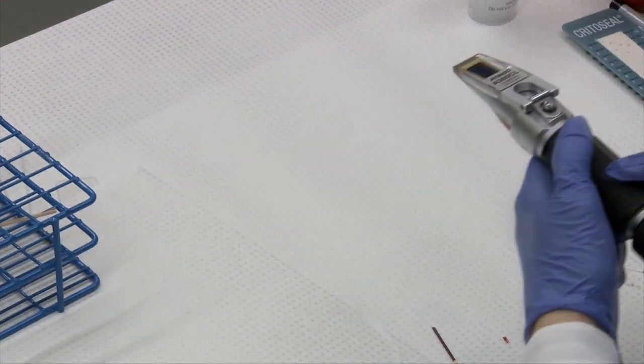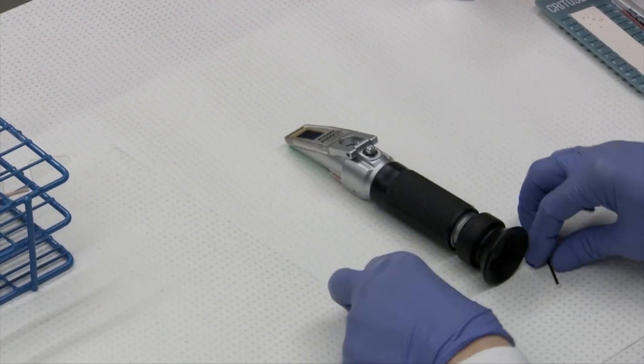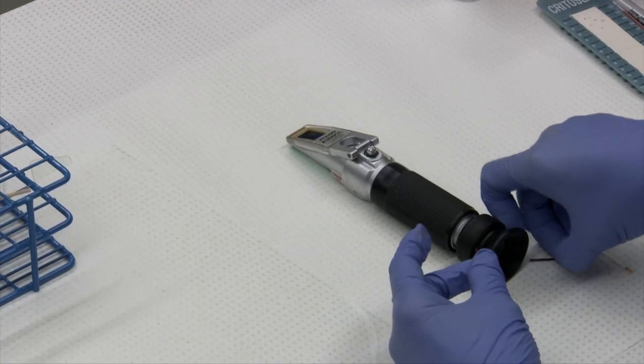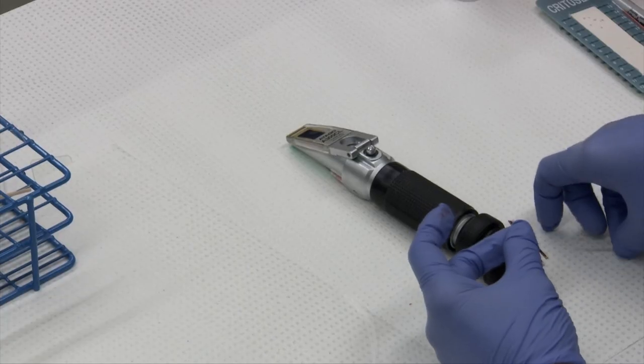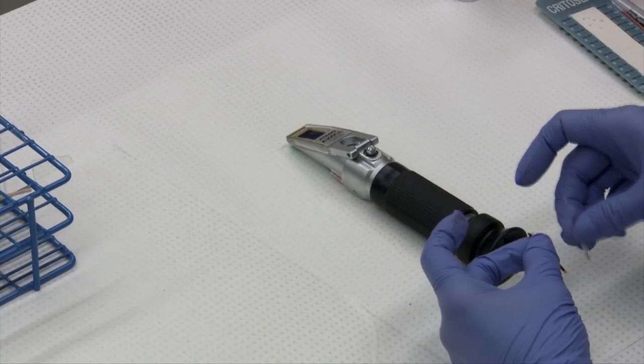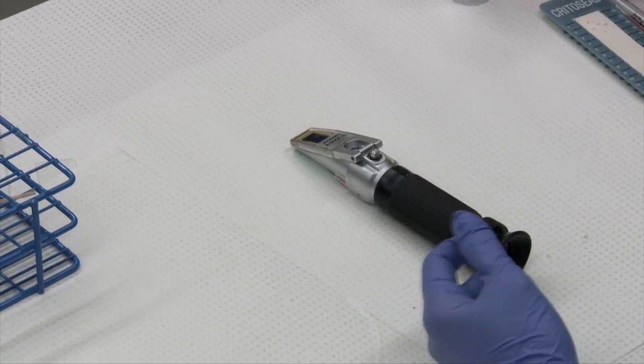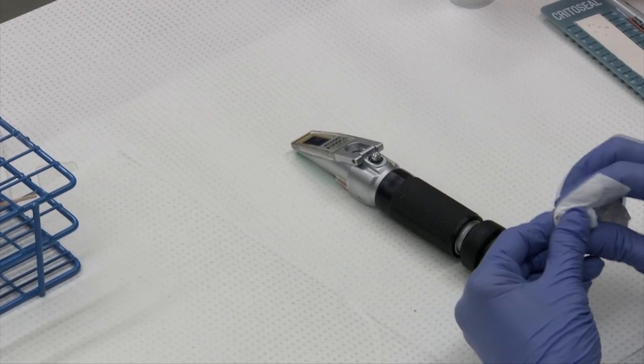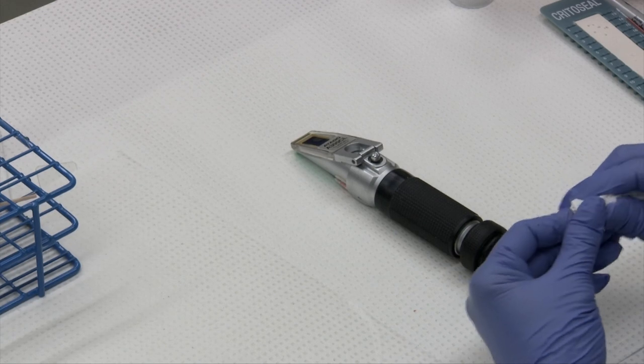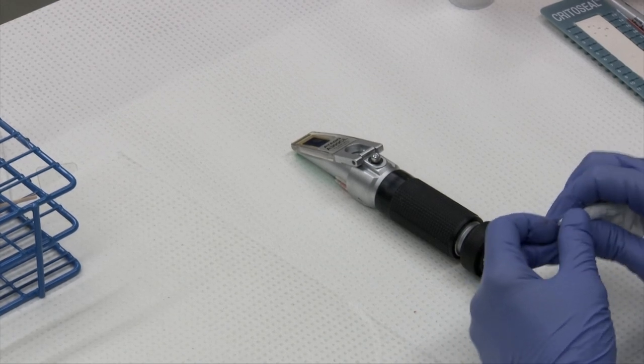Once you're done, you can just wipe your platen off with a Kleenex and then with distilled water to keep it clean.